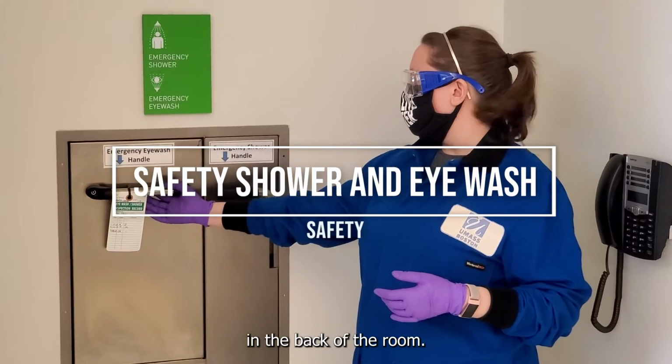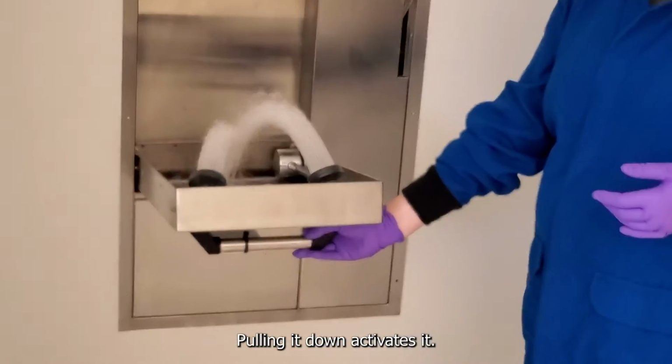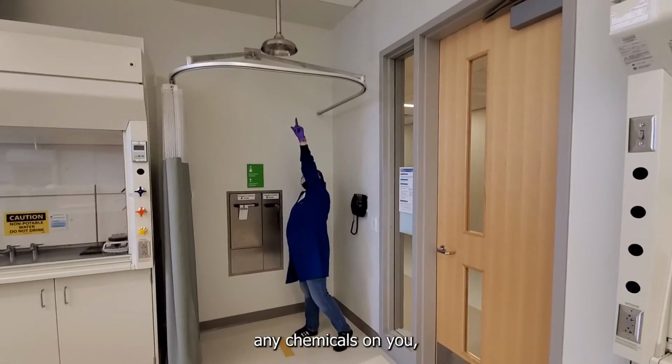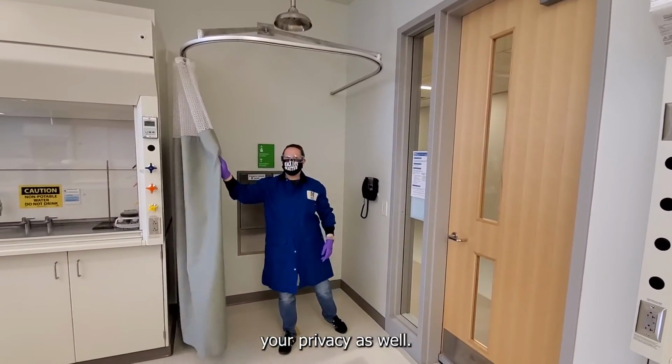A quick refresher on the safety shower and eye wash. In the back of the room, there's an eye wash that's readily accessible. Pulling it down activates it. And if you have spilled any chemicals on you, there's a safety shower. There's a curtain for your privacy as well.